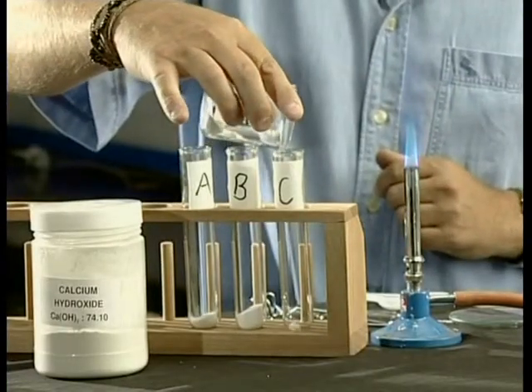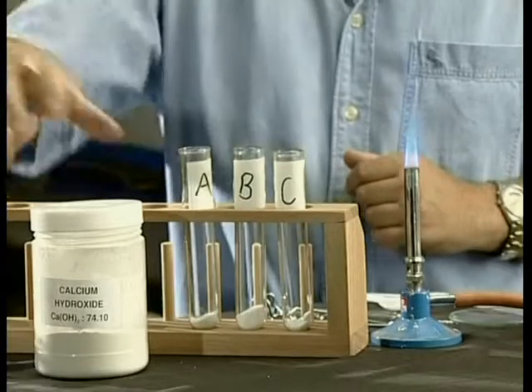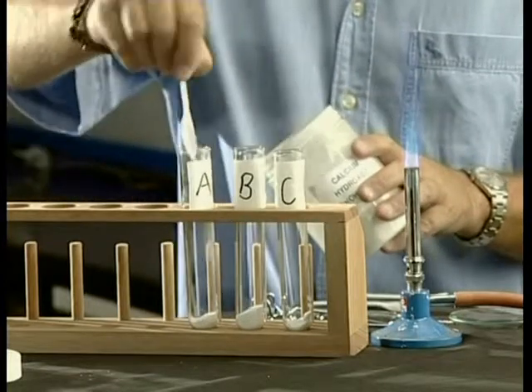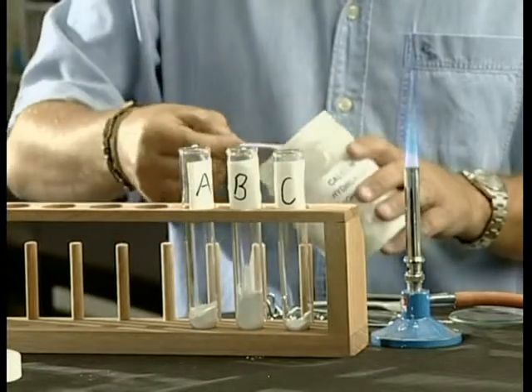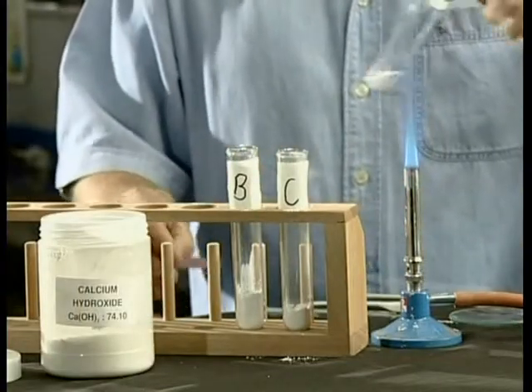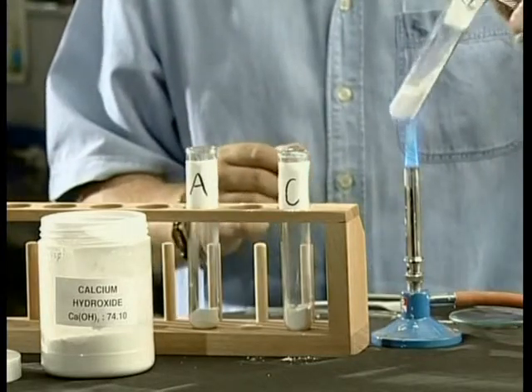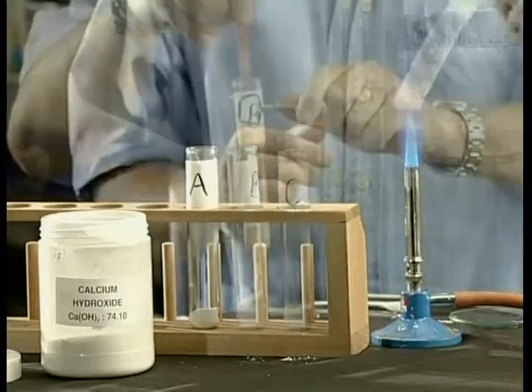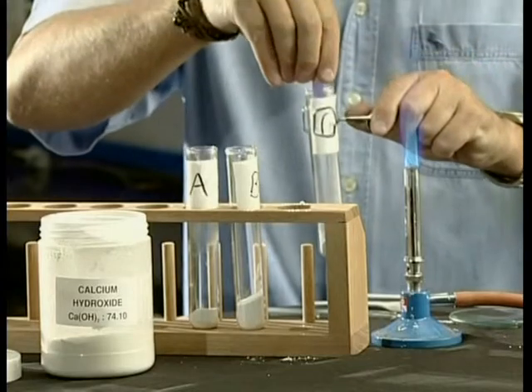We set up three clean empty test tubes and label them A, B and C. Add a teaspoon of each salt A, B and C to the corresponding test tubes. Now add a teaspoon of calcium hydroxide to each of the test tubes and stir the mixture. Heat each of these mixtures over a Bunsen burner. Place moist red litmus paper over the mouth of each test tube. Make sure that you tabulate your observations.